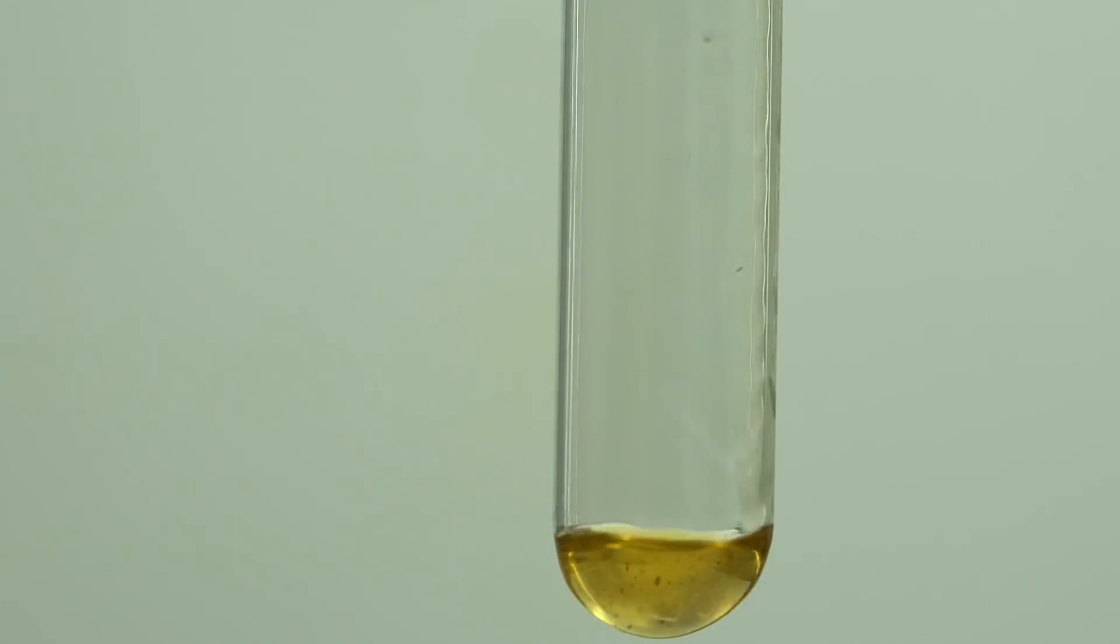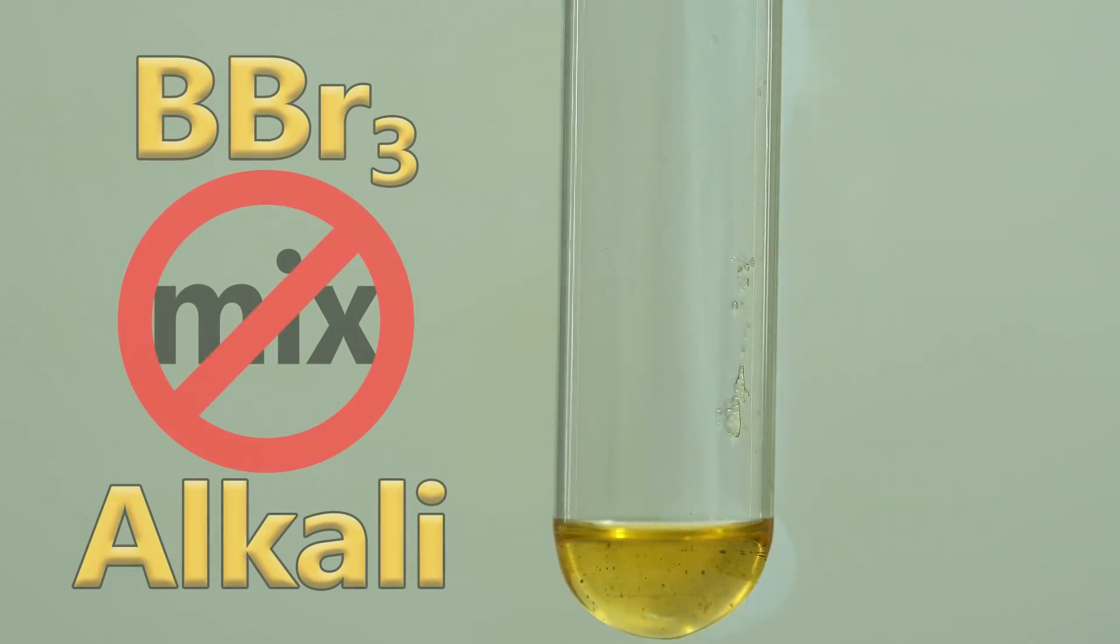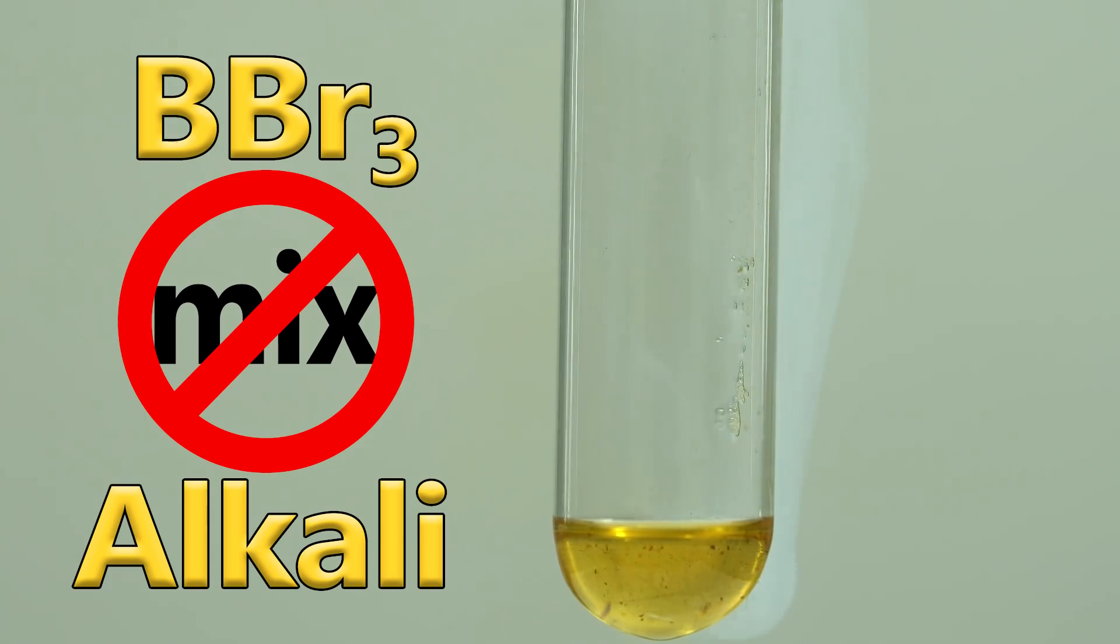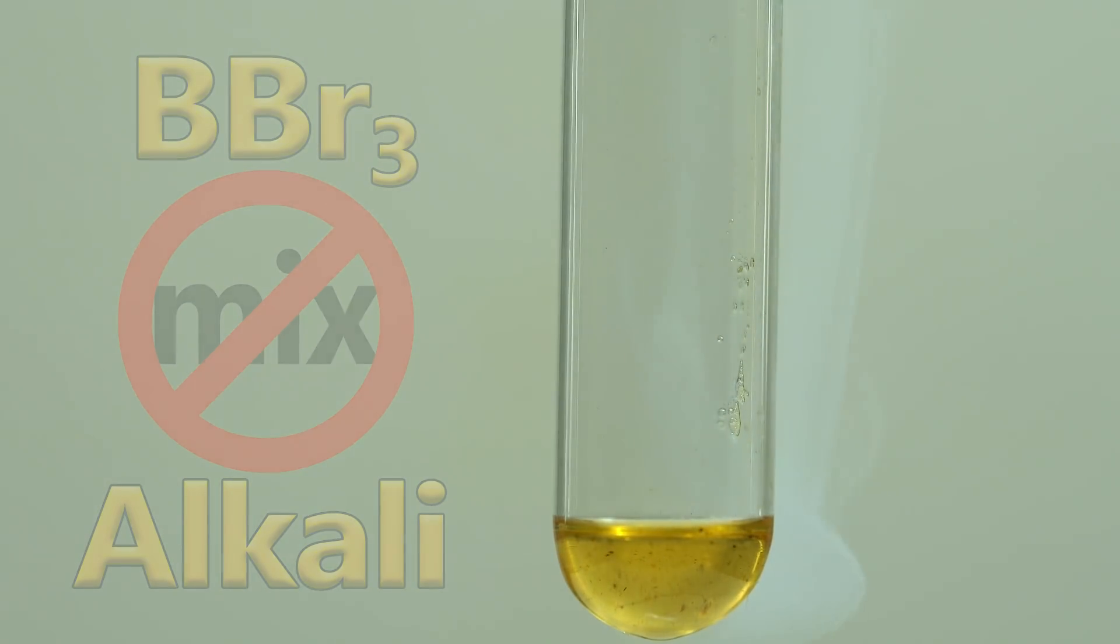Boron tribromide and concentrated alkali solution are incompatible, so let's add a drop of concentrated potassium hydroxide to boron tribromide.